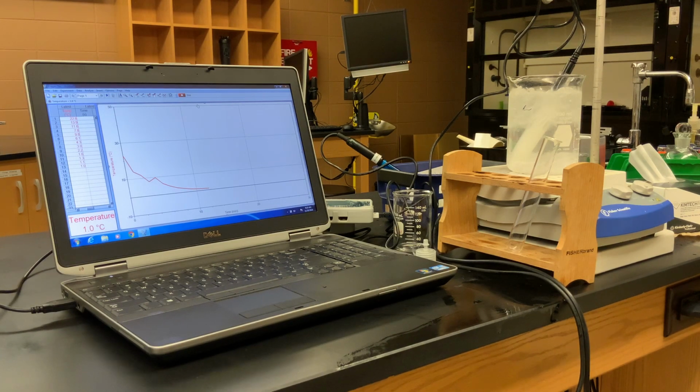Or, well, I correct that, at 0 degrees Fahrenheit. No, I said it right the first time. You don't want it to freeze at 0 degrees Celsius. You want it to have a lower freezing point than water, basically.